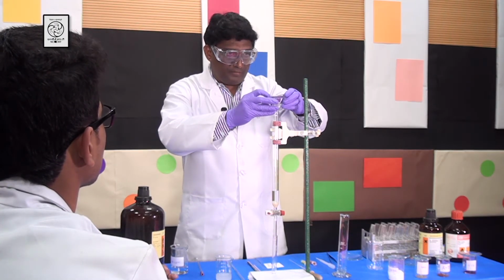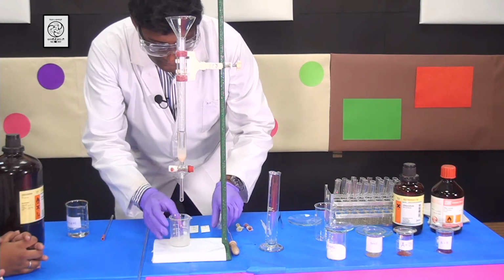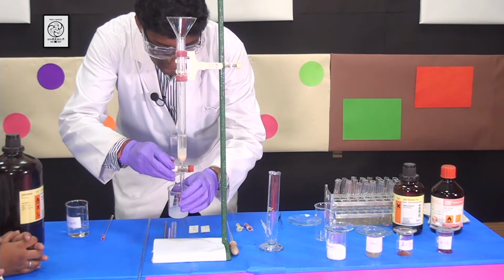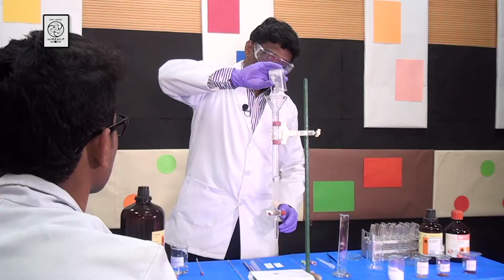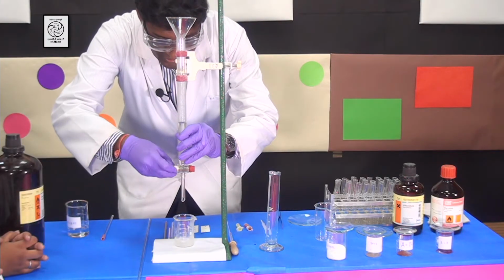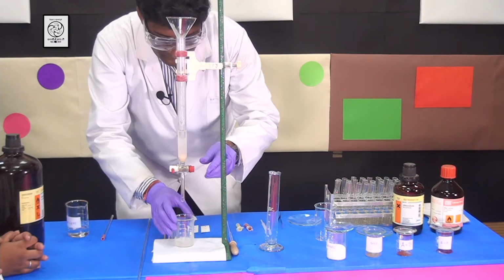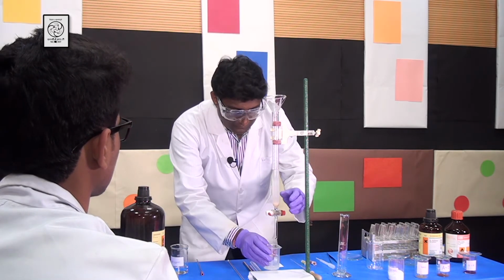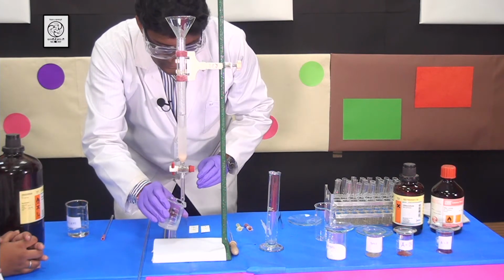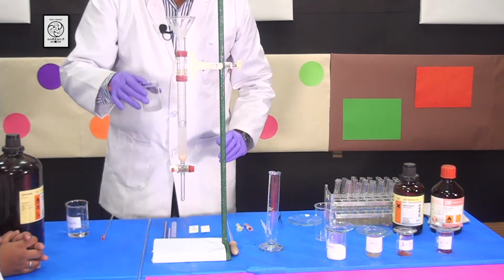Okay, I am putting the glass funnel on the top of the column nicely. Yes. So now at this part you have to do it a couple of times. Okay, then we can collect the solvent. Then you can pour it back. Then you can open the stopcock like this. And then you can collect the solvent. Make sure that most of the silica gel is already loaded into the column.